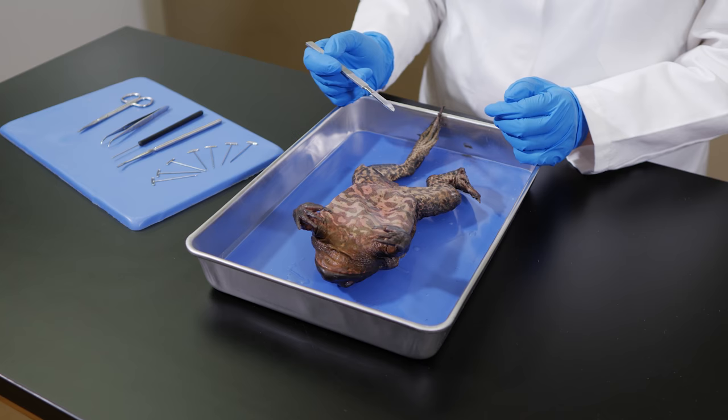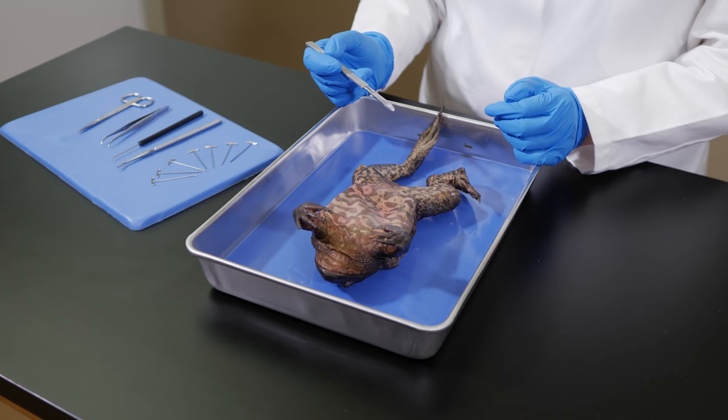When using the scalpel or the scissors, we need to be careful to make short, definite cuts, so our incisions are not too deep or too shallow. Now that we are familiar with some of the terms and techniques of dissection, we are ready to begin our first dissection.